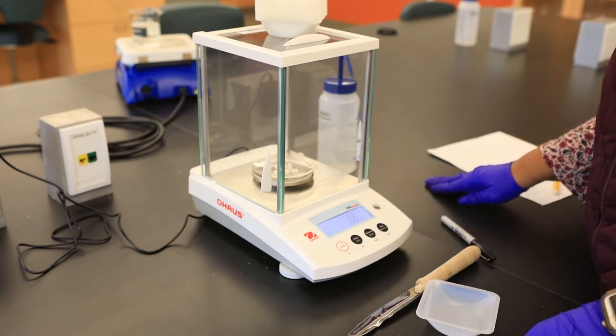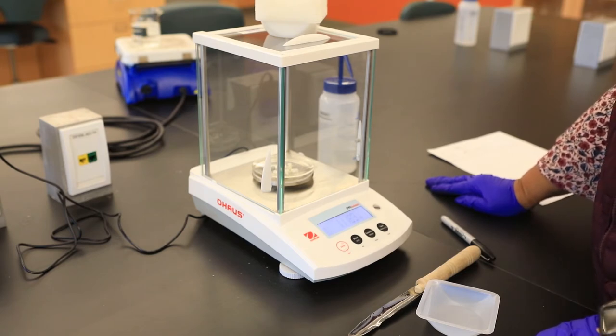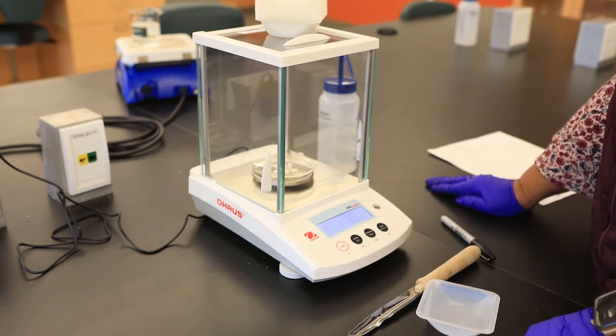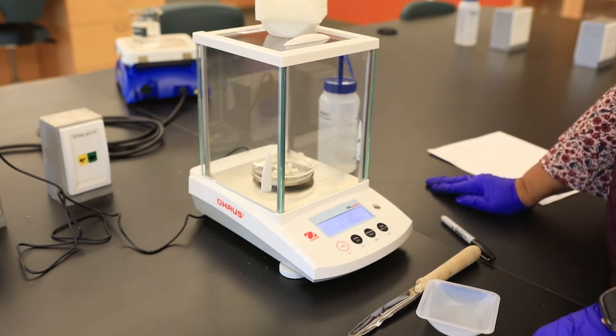We're going to move on to testing our sample. We're going to be doing the biuret test, the heavy metal test, and finally the coagulation test.